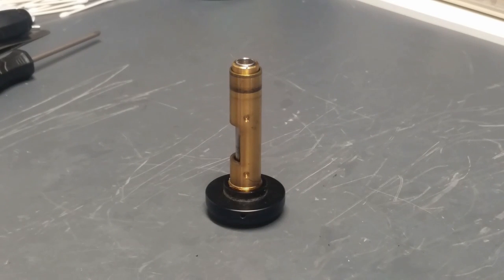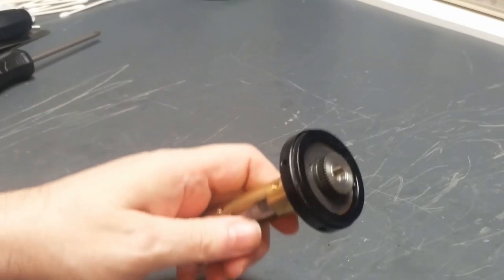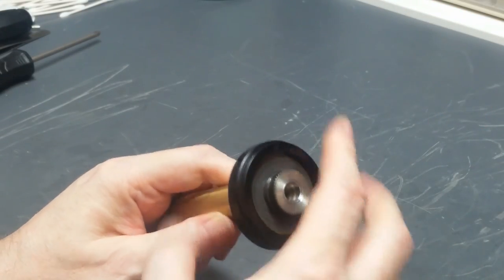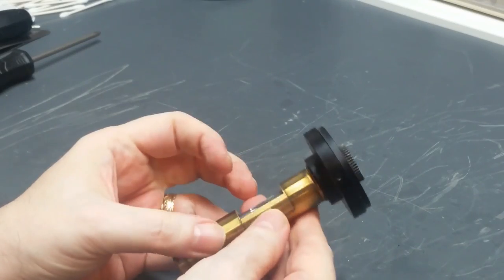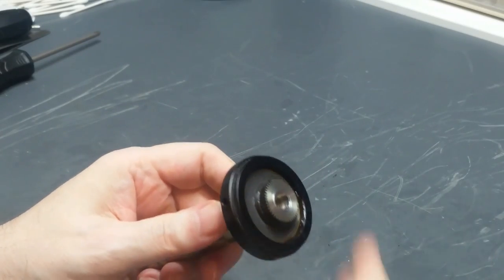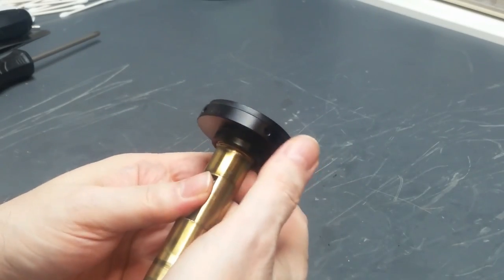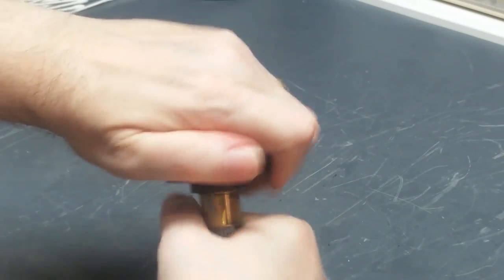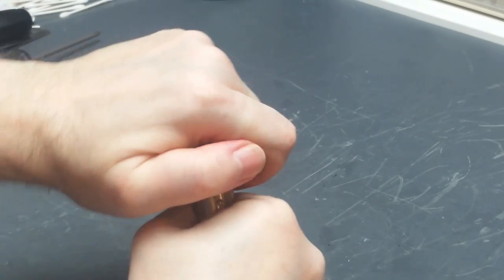Okay, I've set the stand aside for safekeeping so that I can work on this piece here. First thing I want to do is take off this tension adjustment knob. It just screws onto this brass pinion carrier here. It does have left-hand threads, and I want to back it off this way, but since it has left-hand threads, I have to turn it the other way.